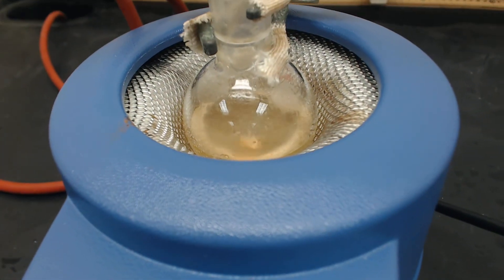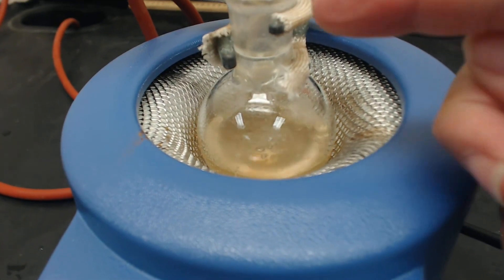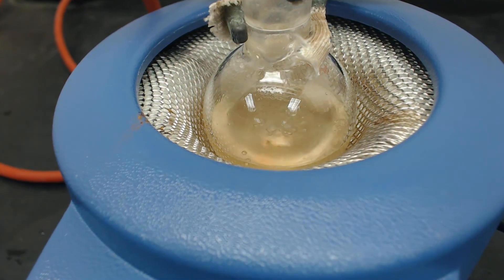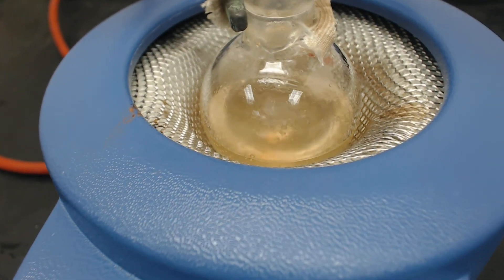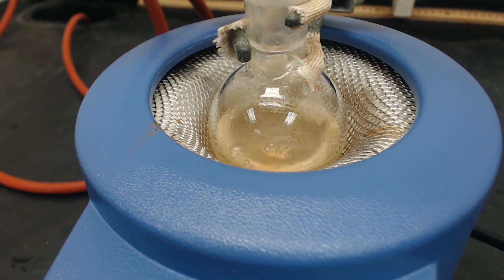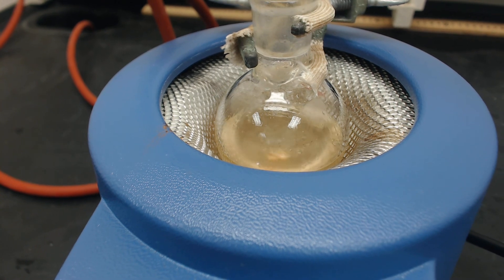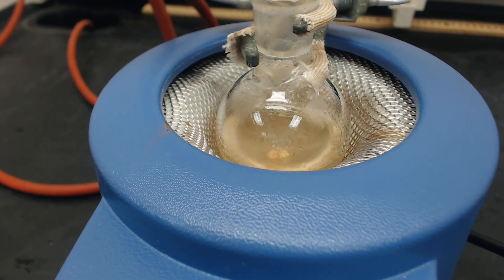Let's see if I can get it from this point of view. You can see right here where it's dripping back into the solution. We're going to let it reflux for about 45 minutes. I'm actually going to stop this video and start a new video when we get to the next part.